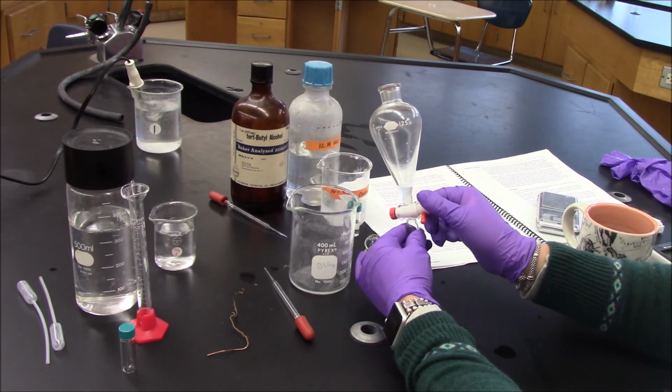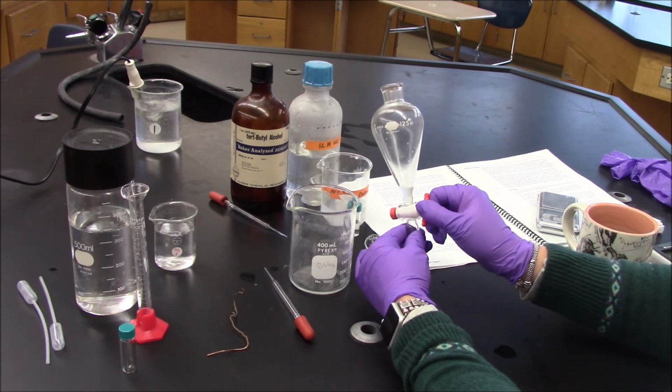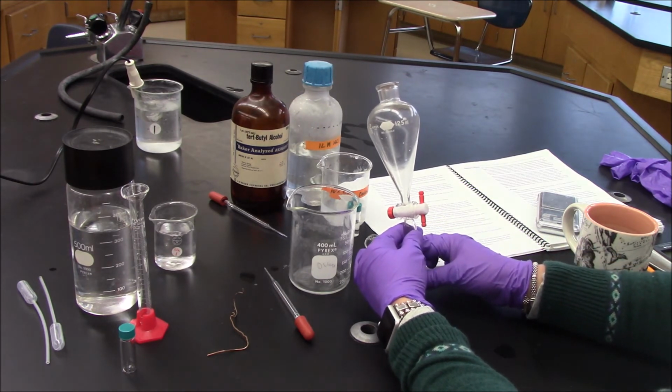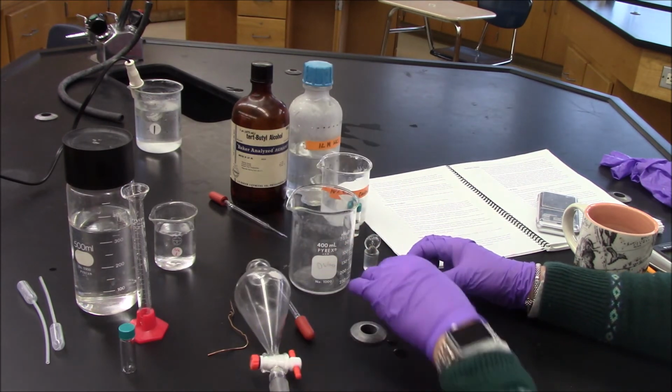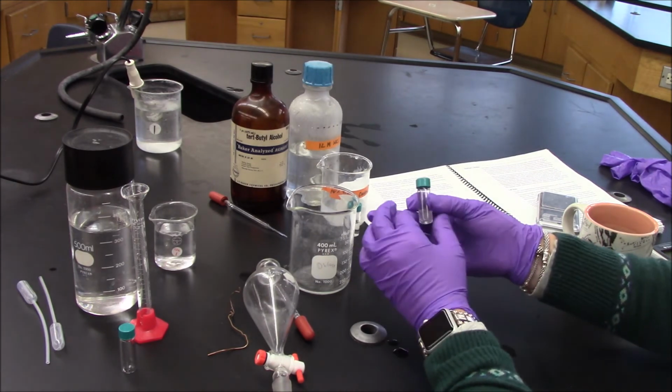Is it in the camera? It is. Slow. Let's see if I can get it in here, guys. There we go. Look at that. Perfect. All right. I did it. Ooh, it smells. It's a good sign.